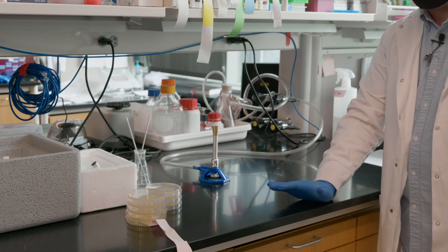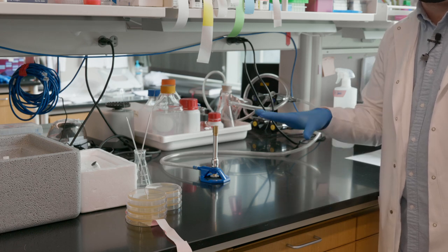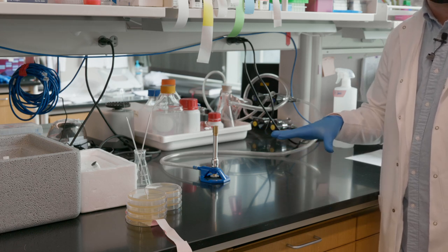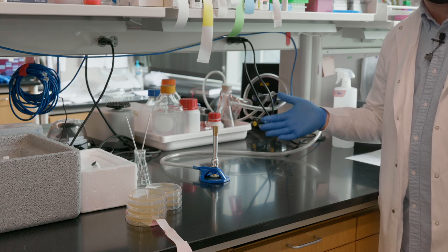By streaking out plates on colonies, we'll isolate individual bacteria and every member of that colony should be genetically identical. This procedure is important to have as sterile as possible a working environment in order to not introduce any other microbes in the area into your plates.